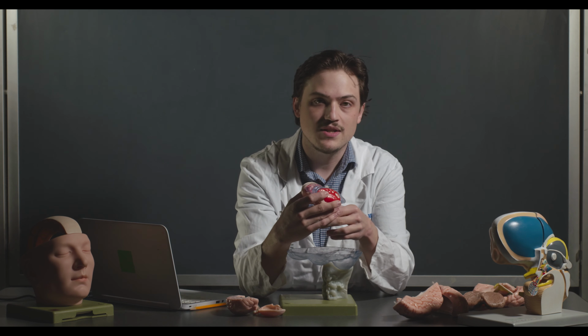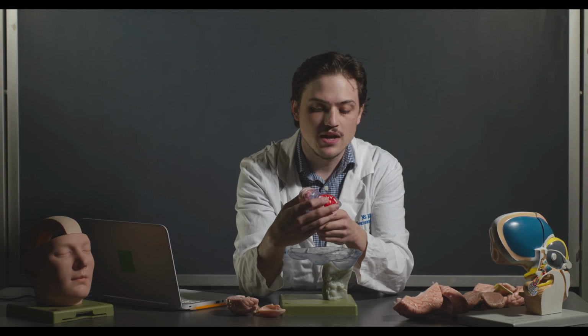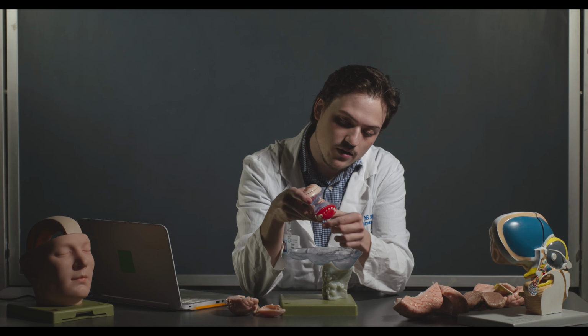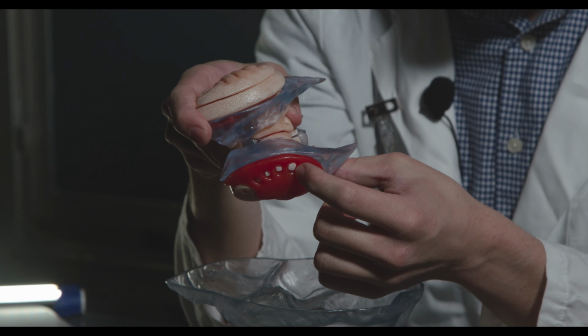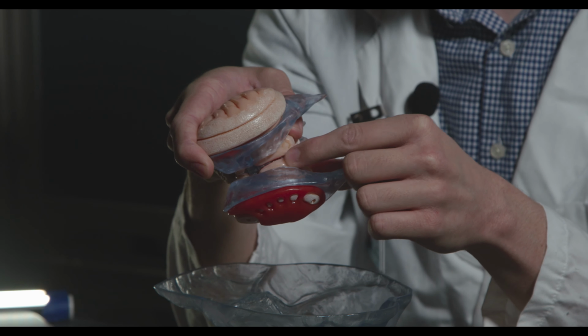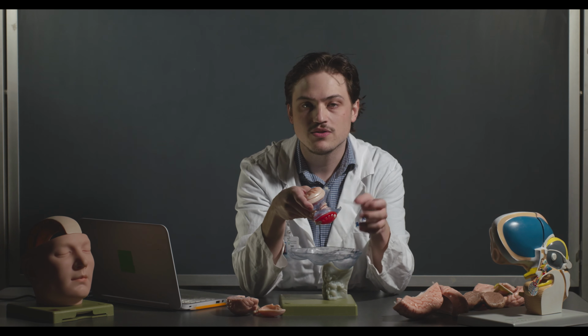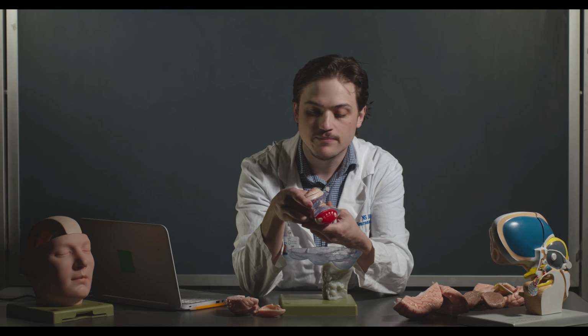The thalamus is actually located a little bit medial and caudal to the basal ganglia. So here are those basal ganglia structures, and then in here is actually the thalamus. You'll see that a little bit more on the sheep brain when we take some of this stuff apart, and you'll also see it on the human brain models next week.